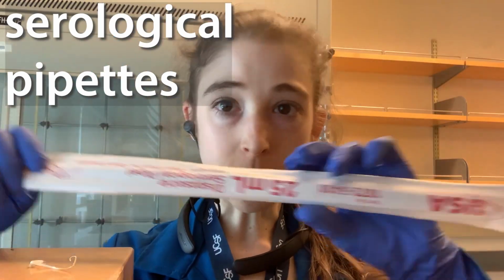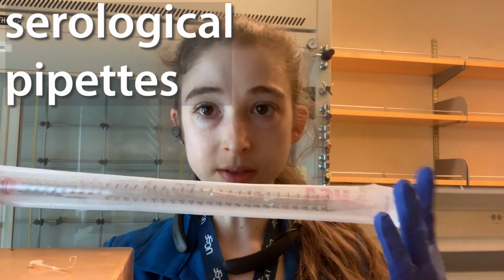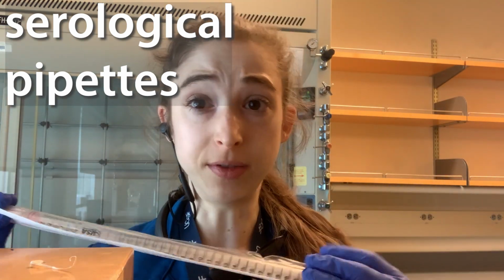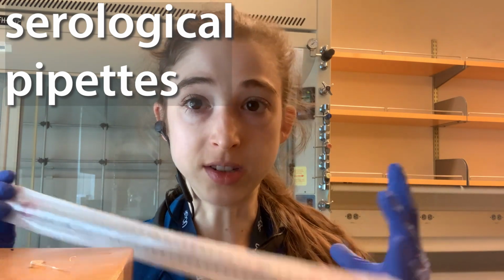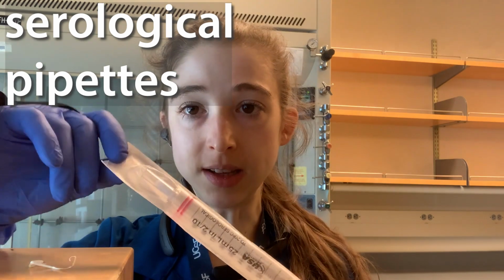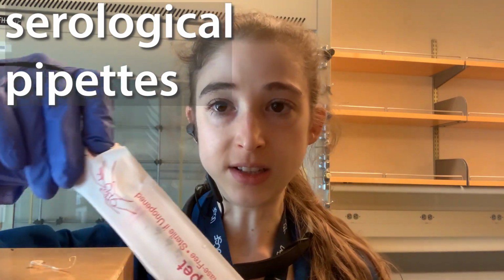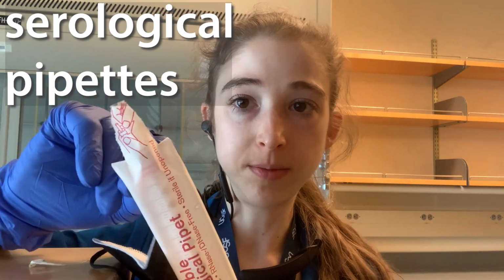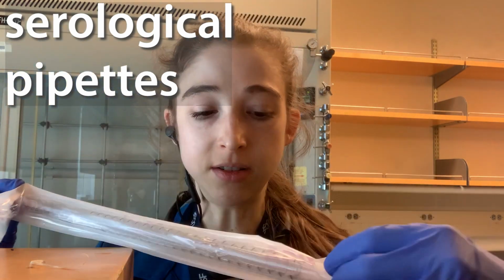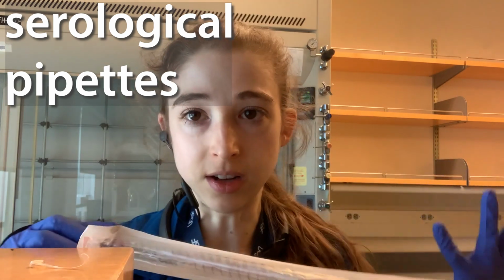One more note is when you're opening the individually wrapped serological pipettes. Some come individually wrapped, which is especially important for cell culture. Others come in bulk, so they're just in bags. When you're opening them, you want to make sure that you're opening the side with the plug. Basically, you can just push through here. You don't want to open the side of the tip, because then you're going to end up touching the tip, and that's not good.